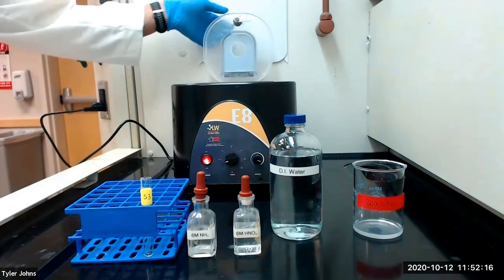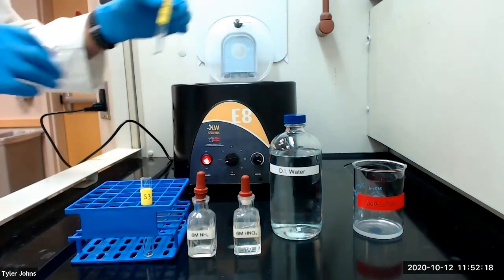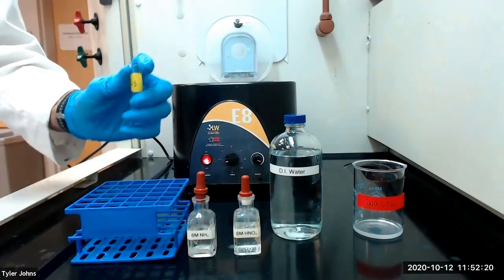After centrifugation has completed, we will transfer our solution to a new test tube labeled S3.